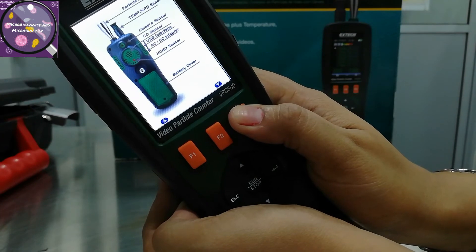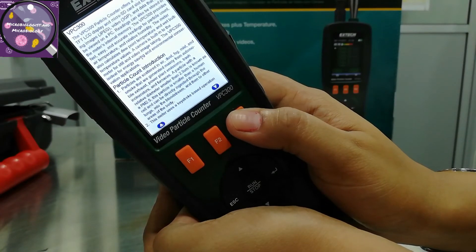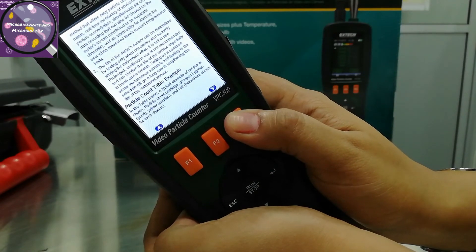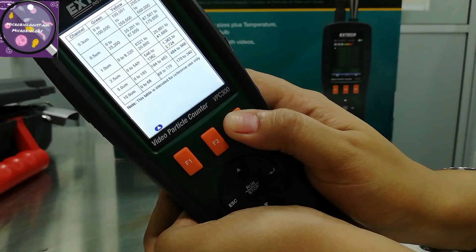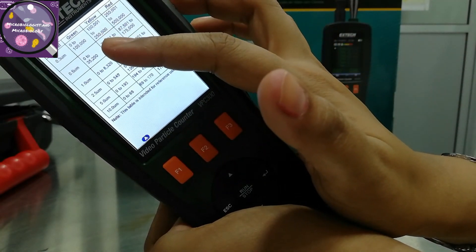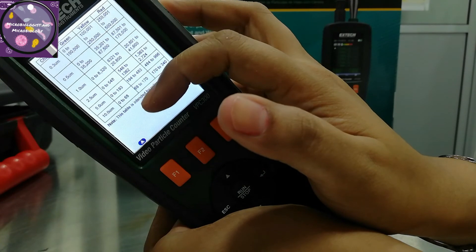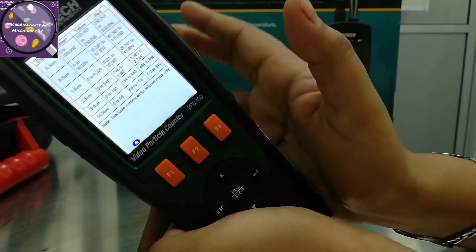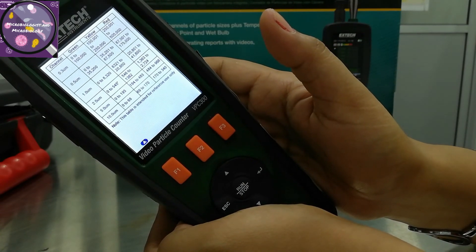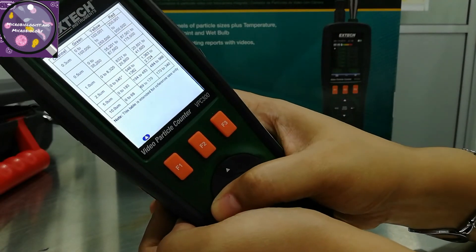If I want to change the page I press the F3 key again. Here is the model detail — it is VPC 300. It shows a description of what the particle count test is and why we use this device. There are some limits set by the counter, and it is also related to WHO guidelines. It shows sizes and channels, and it depends on us what channel we decide — but follow your SOPs and the WHO guidelines.